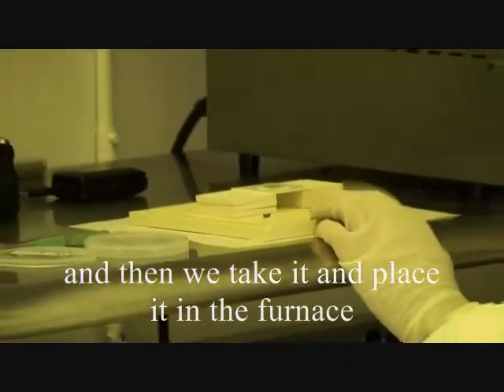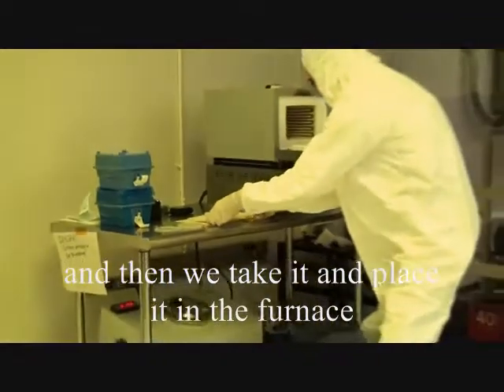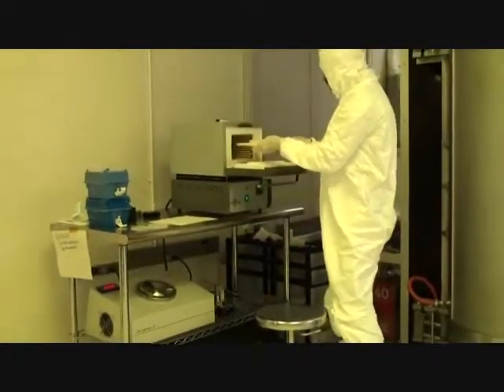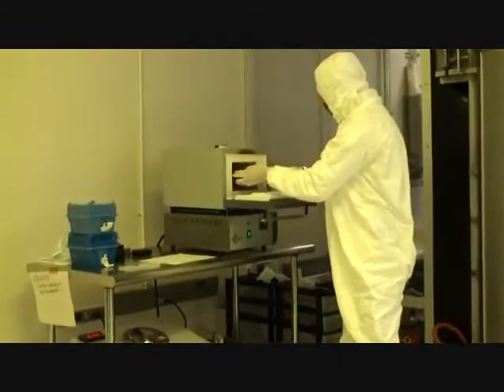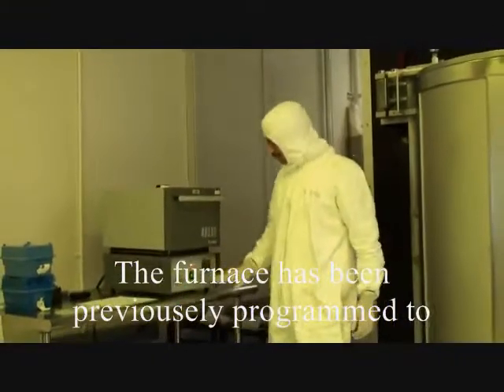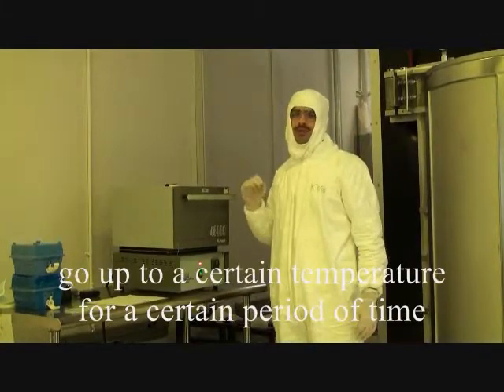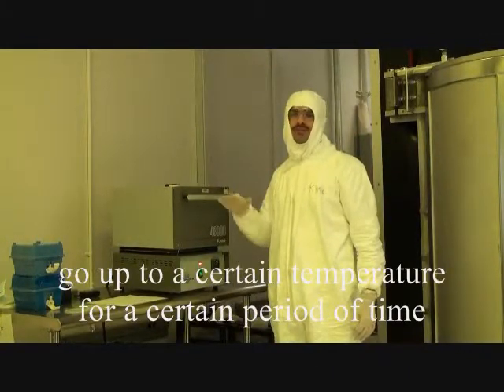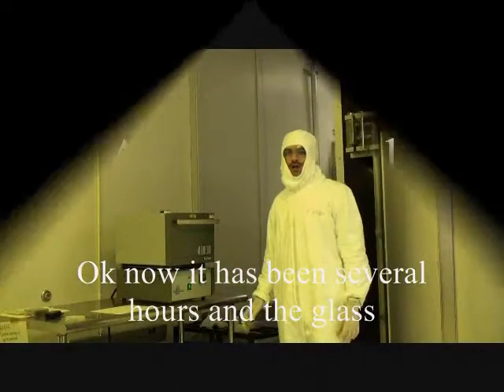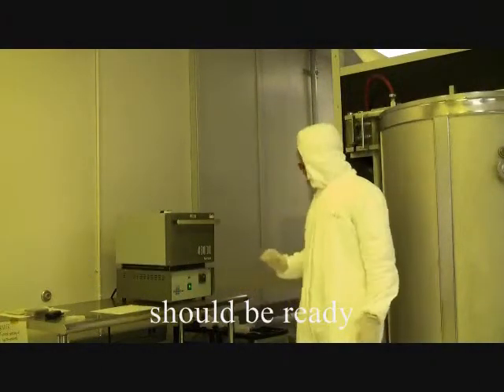And then we are going to place it in the furnace. The furnace is previously programmed to go up to a certain temperature for a certain period of time, then come down to room temperature. Okay, now it has been several hours and the glass should be ready.